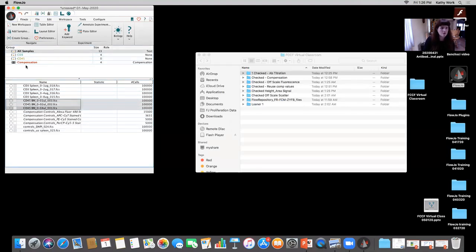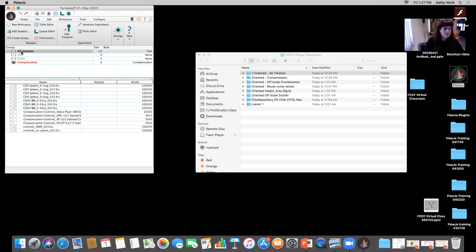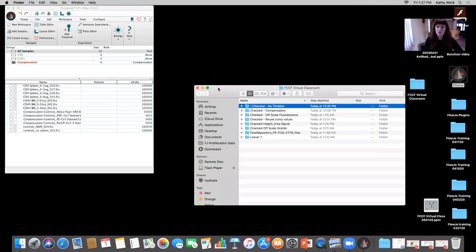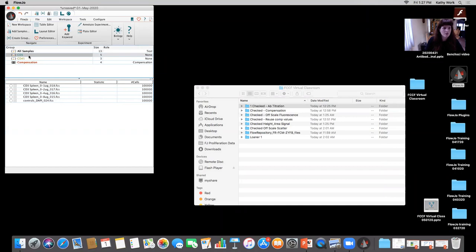And then also the CD45, I can drag up to CD45. Okay. So, not sure why that one's not going in there. I'll have to take a closer look at that a little bit later. Sometimes every once in a while, bizarre things will happen and I'll take a closer look when I get the time. Let's try this, the DAPI went in. Interesting.